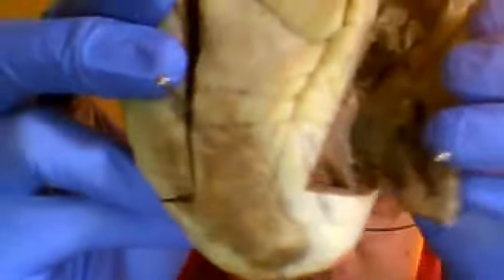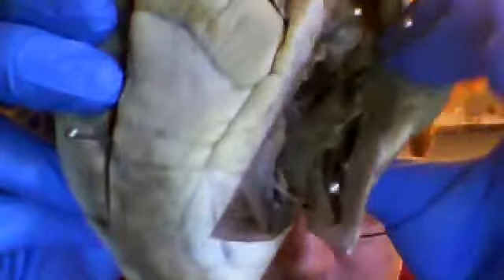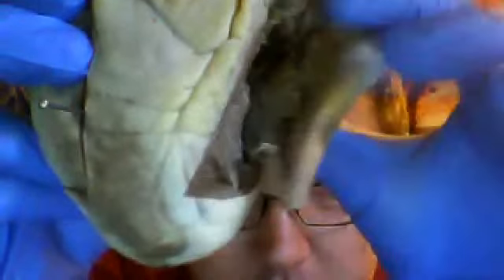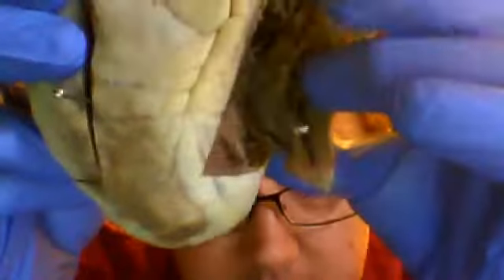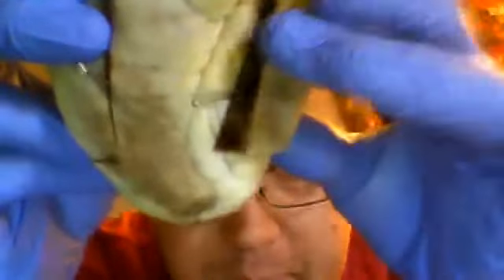Now, while we're talking about ventricles, you have the right and left ventricle. The right ventricle is located right here, and it is the area that is inferior to the valve that I've pointed out right there. If you were to look at it on the outside, it's comprised of mostly this area here. It has a relatively thin muscle, called myocardium.